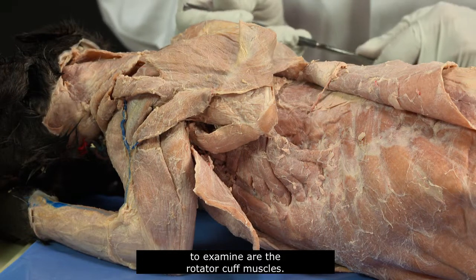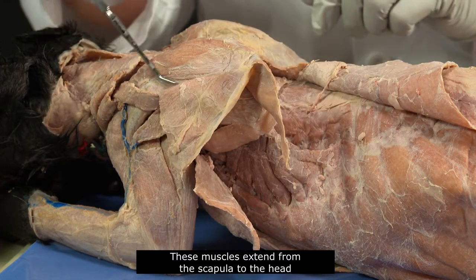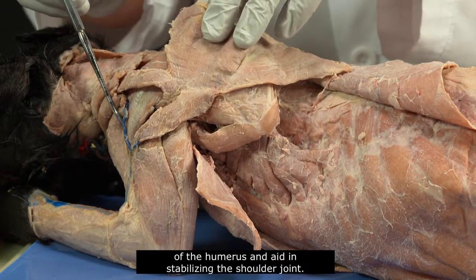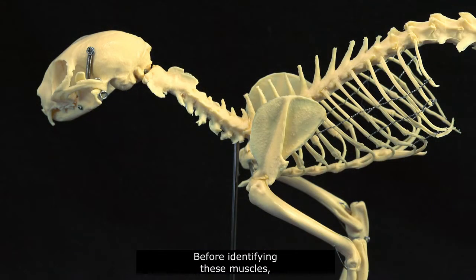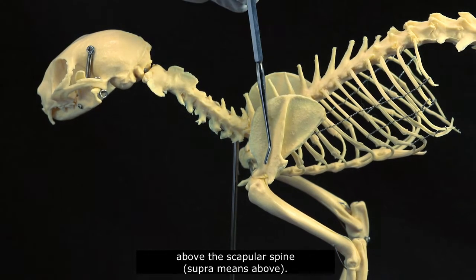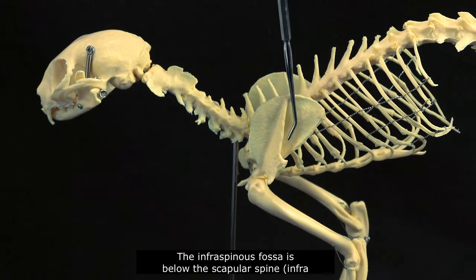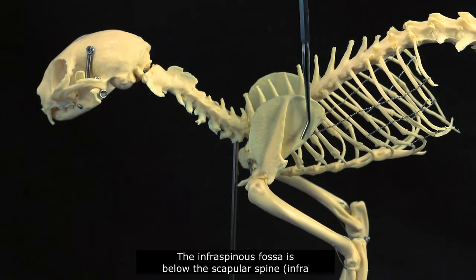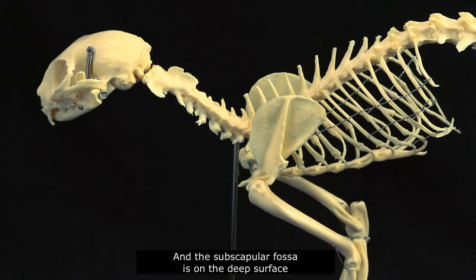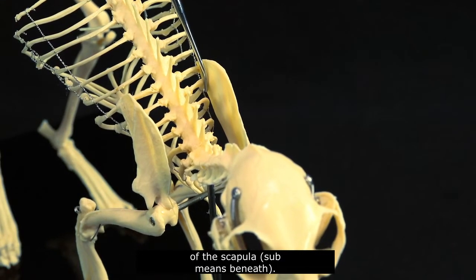The last of the dorsal muscles to examine are the rotator cuff muscles. These muscles extend from the scapula to the head of the humerus and aid in stabilizing the shoulder joint. Before identifying these muscles, let's review the skeletal anatomy of the scapula in the cat. The supraspinous fossa is above the scapular spine — supra means above. The infraspinous fossa is below the scapular spine — infra means below. And the subscapular fossa is on the deep surface of the scapula — sub means beneath.